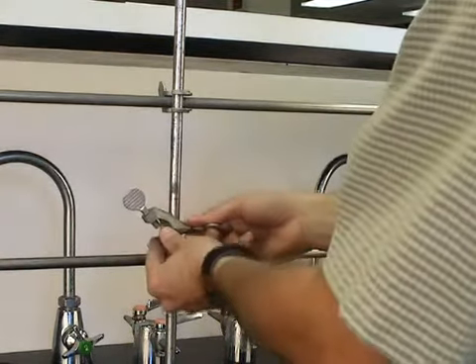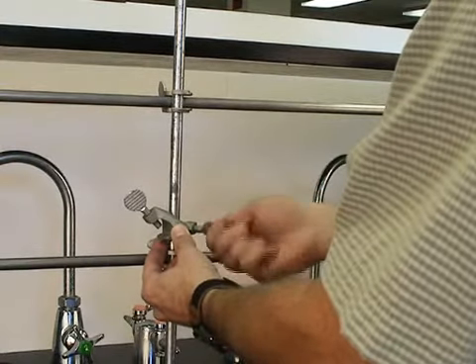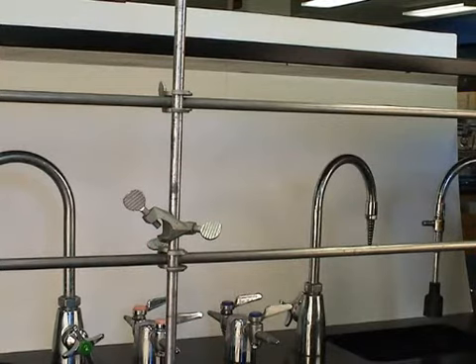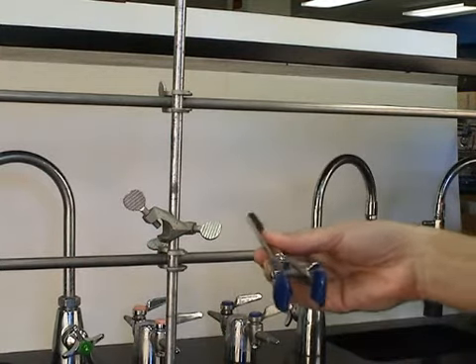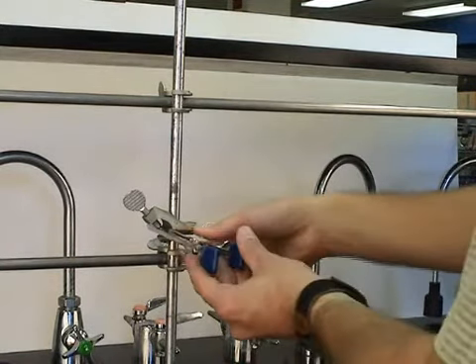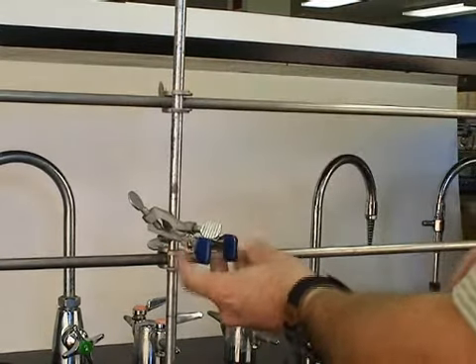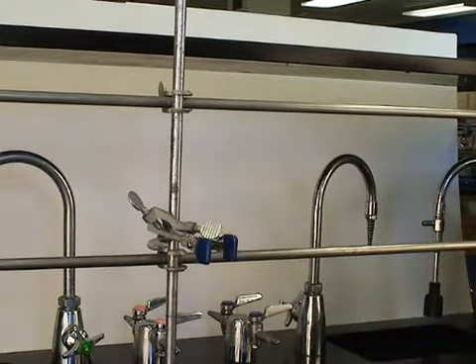We use a clamp holder. There are a couple different styles of these. Clamp it near the bottom of the vertical rod and then put a flask clamp into the clamp holder. And this also needs to be firmly mounted as it's going to be the base of the apparatus.